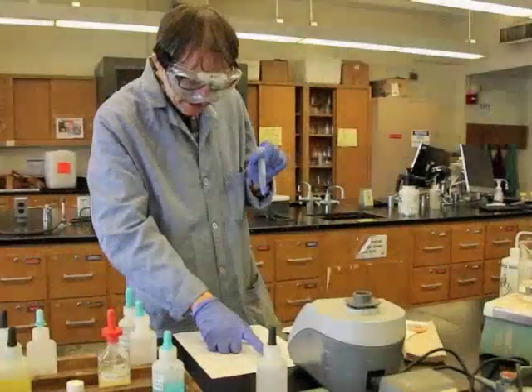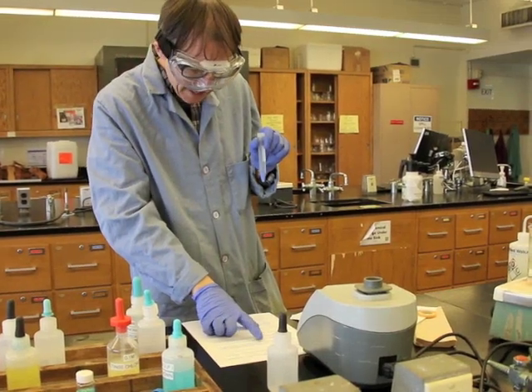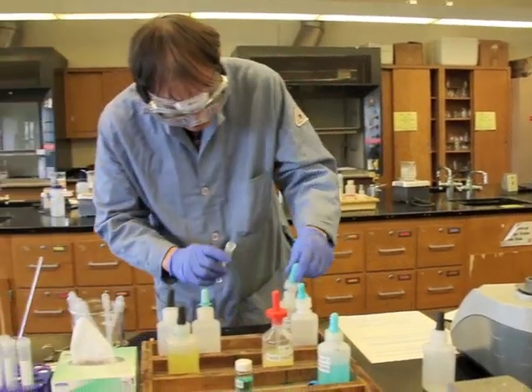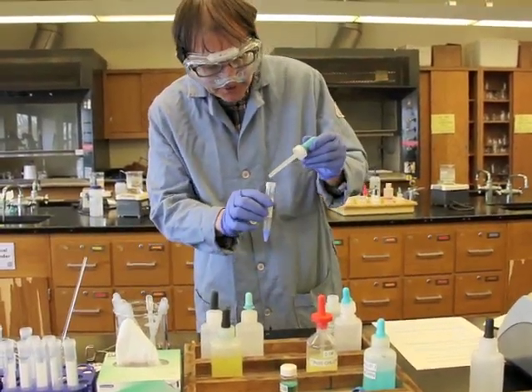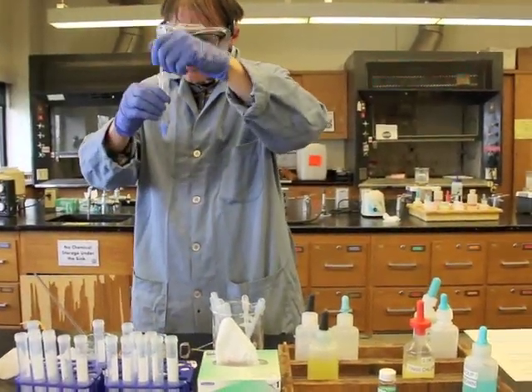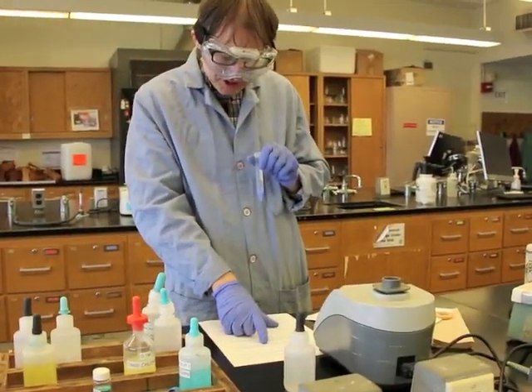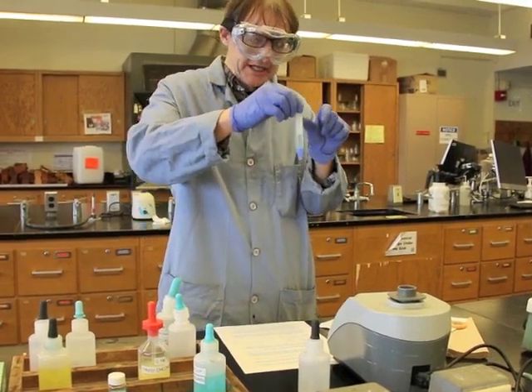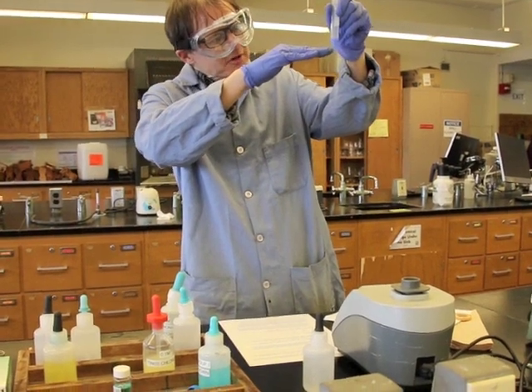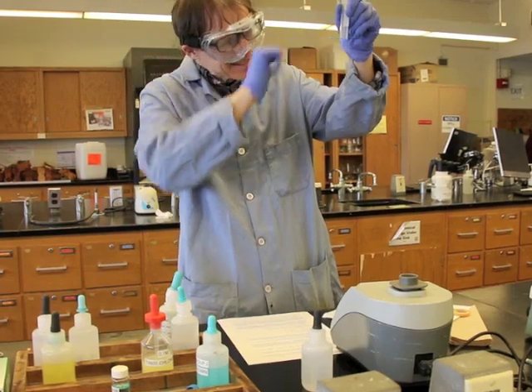The next step says to add enough to make sure that it's precipitated, add 2 more drops. So we're really just going to make sure that we added enough. 1, 2, and then stir. We know we definitely added enough right now. Now, once we've done that, we're going to stir, centrifuge, and decant, pour off the supernatant, okay? So we're going to do the centrifuge now. The centrifuge should make the solid that formed in here go down to the bottom and the liquid go up to the top because the solid is more dense than the liquid.